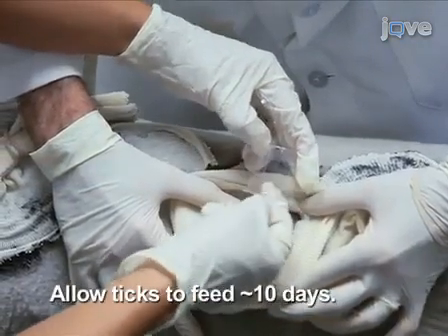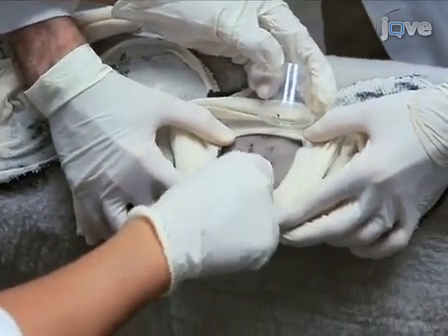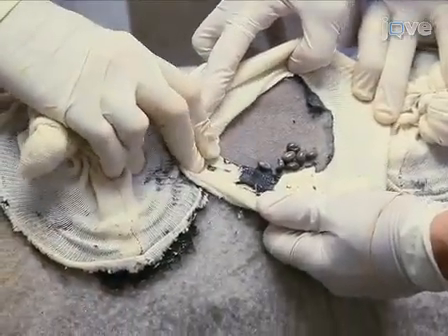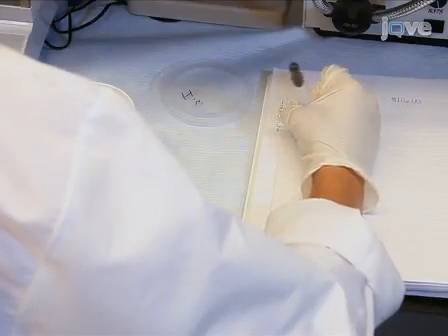Next, place individual ticks into tick-feeding cells glued to a sheep and allow them to feed with an equal number of uninjected male or female ticks, whichever sex was not injected. Collect and weigh female ticks from the feeding cell after they complete feeding for approximately 10 days, or when the control females have dropped off the host.